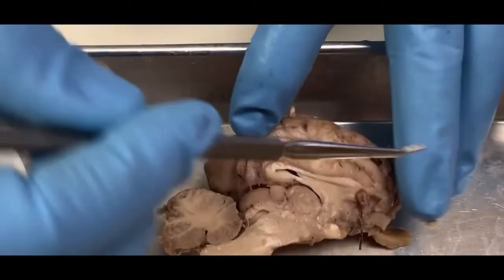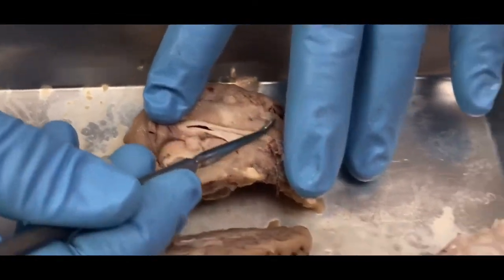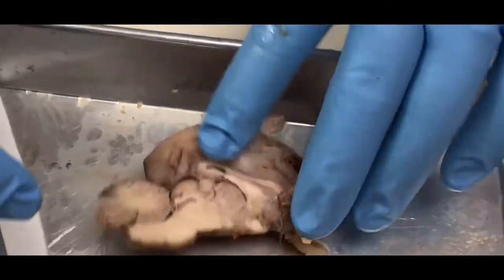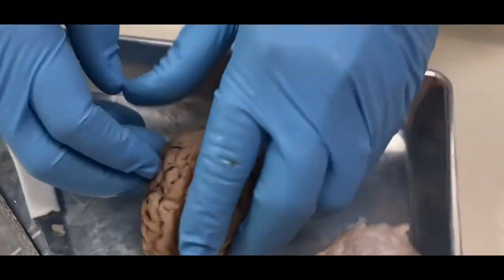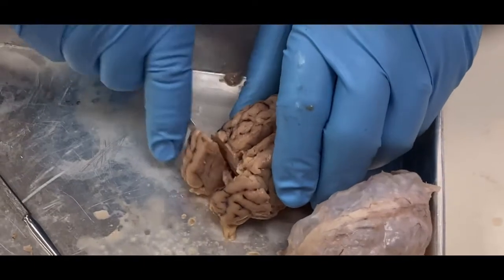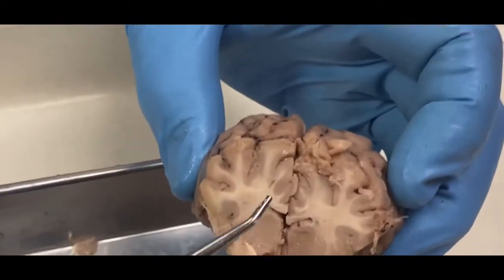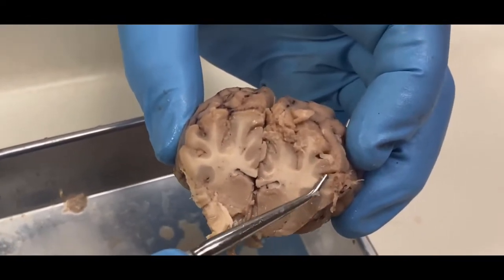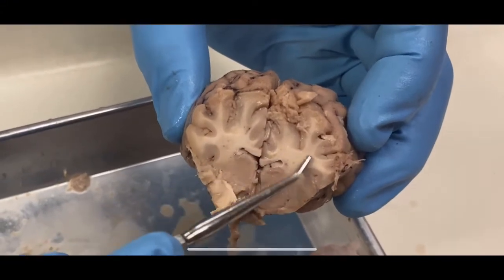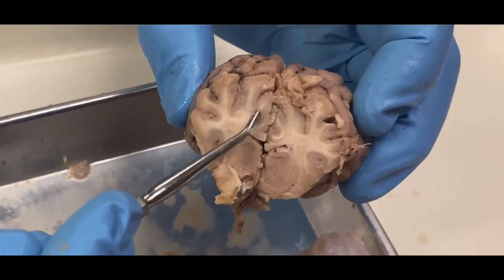If you notice up in here, I also have gray matter up in here, right? If I look at here and compare it to here, this is my gray matter, okay? And then what I'm going to do is take the brain and cut it like this, okay? And if we look, you'll also see there's more white matter there. And when you see these darker areas, that's gray matter, and this would be my cerebral cortex once again. So the white part is myelinated fibers, and that's white matter. And then these other parts are gray matter.